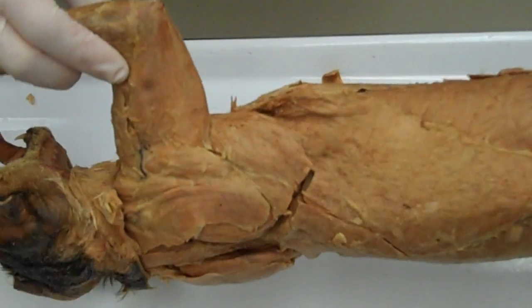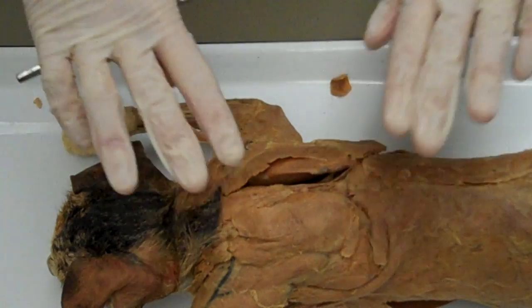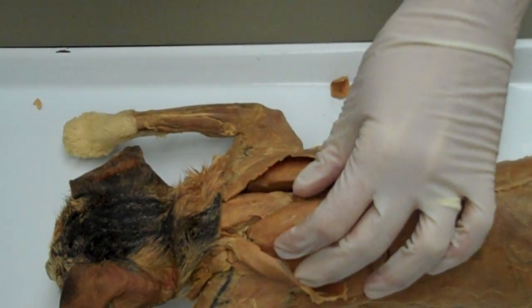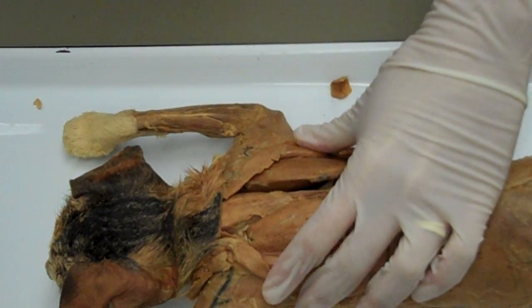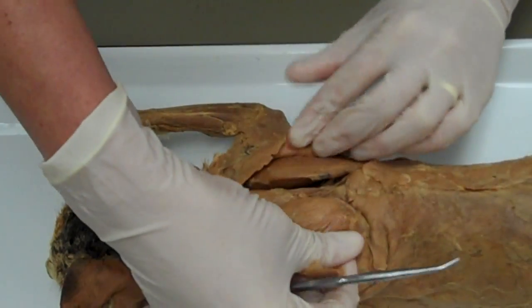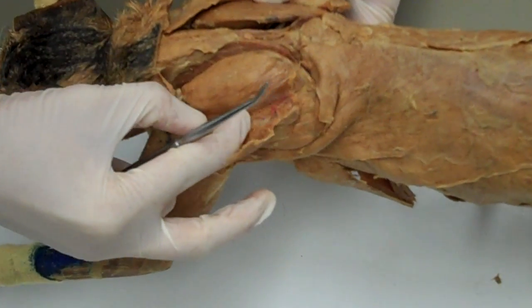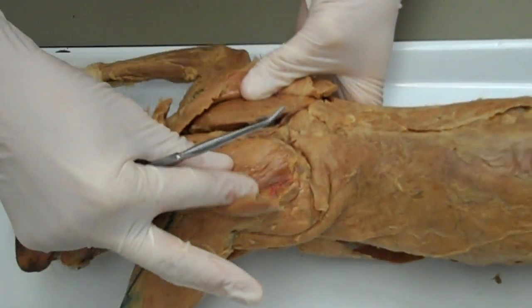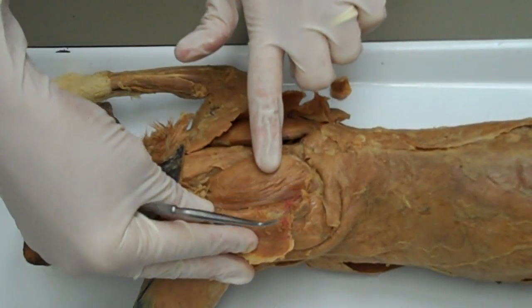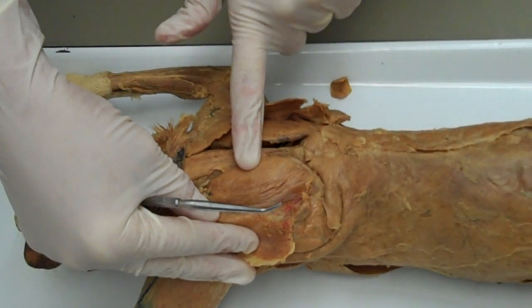Moving back to the posterior aspect of the cat, I'd now like to show you some more deep muscles to the trapezius. I'm going to reflect back the trapezius to show you these deep muscles. The first one is the supraspinatus — your landmark is to feel for the scapular spine. Its origin is in the supraspinous fossa of the scapula and it inserts on the greater tubercle of the humerus. Its action is to abduct and stabilize the humerus.